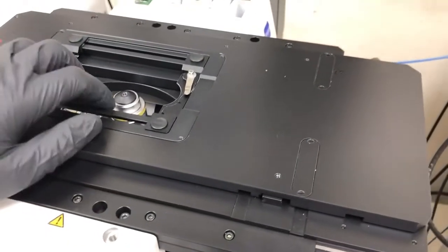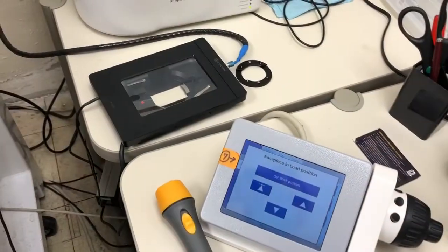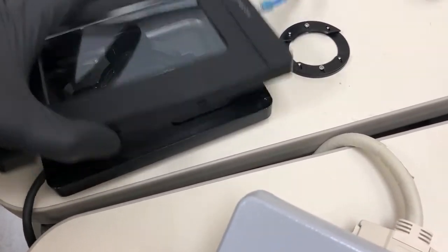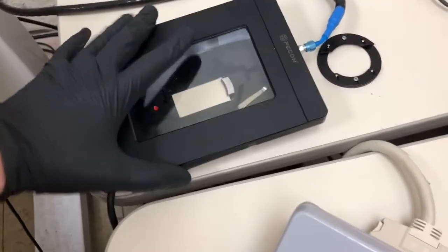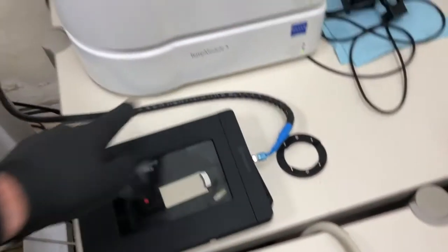Okay. Once that's done, I'm going to remove the current insert, and I will have to put this one on. So let's first take a look at what the components are here. There's this lid, okay, that's a heated lid, so if you touch it, it'll feel warm. And this is also where humidified CO2 is inserted. You can see this hose goes to this.